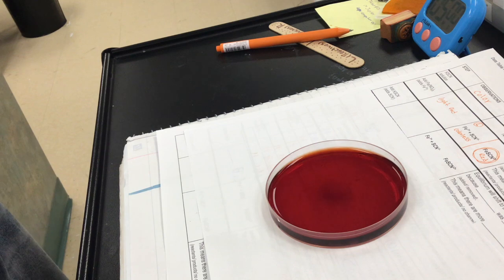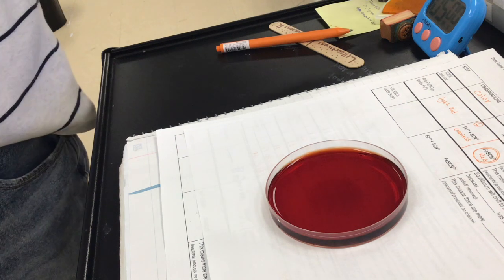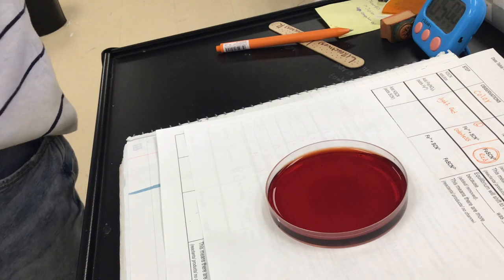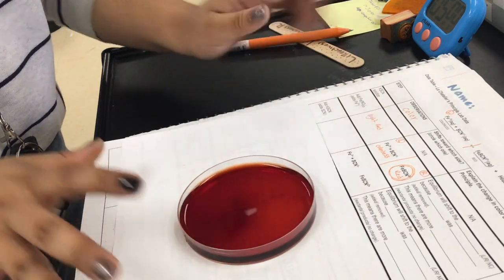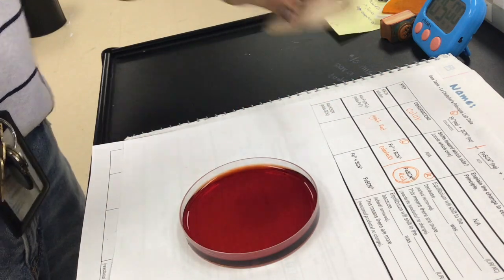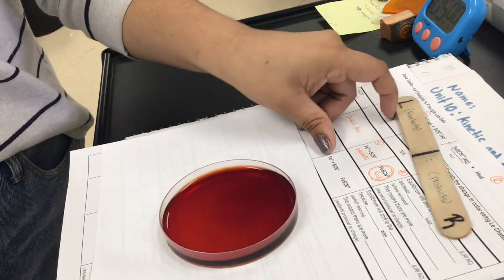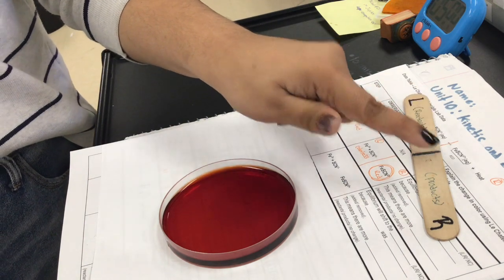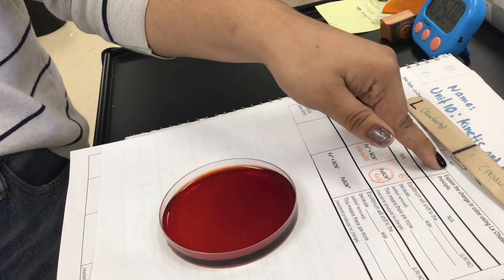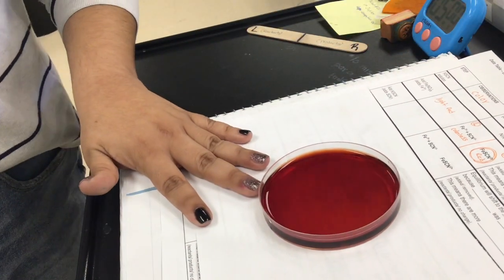Interesting. Okay, so let's try to understand what happened right here. I'm gonna put the light on. Okay, so we added, if you notice over here, we added SCN. SCN is on the reactants. So the only way to go back to equilibrium is to increase the products. And what color are the products? Red. And that's why it became this super dark red, because we added a lot of this one.